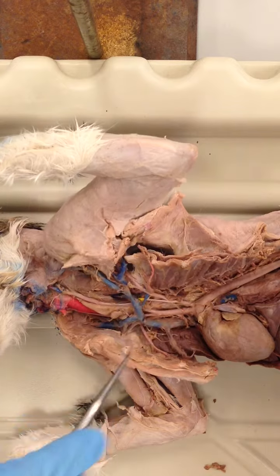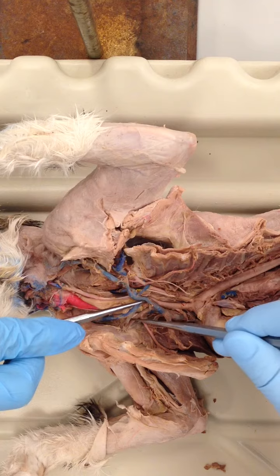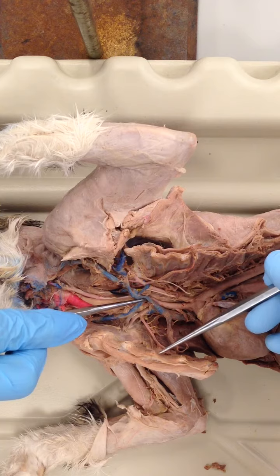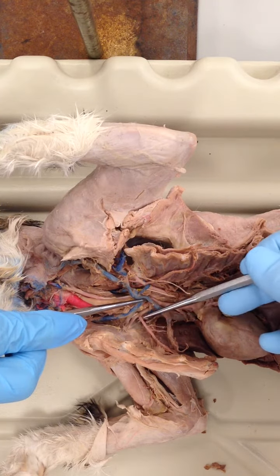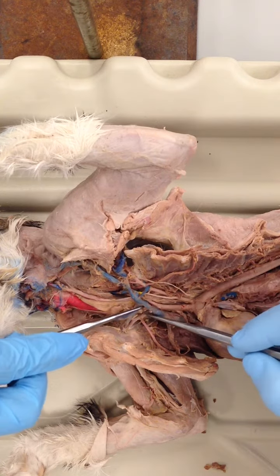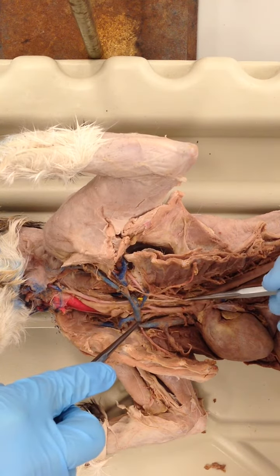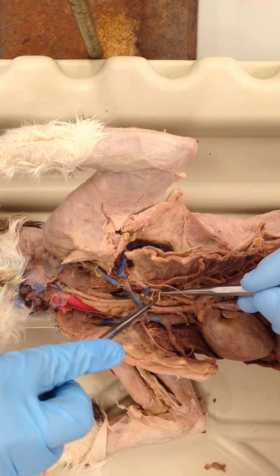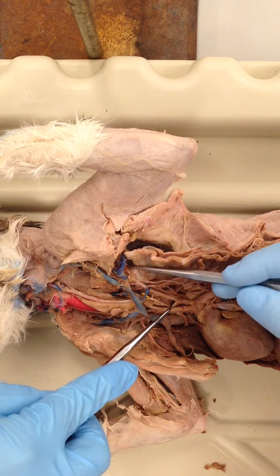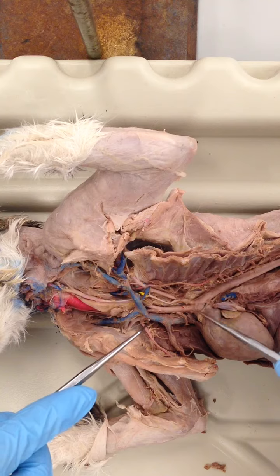The right subclavian artery, as we move that vena cava out of the way again, follows under the vena cava, and you notice here a branch that would trace up into the chest wall. That is the internal thoracic or mammary artery. Alright, so we'll move back towards the aortic arch, and then come back up the left subclavian artery. Sorry, there's a nerve right there. So this is the left subclavian artery, and you can follow that up.